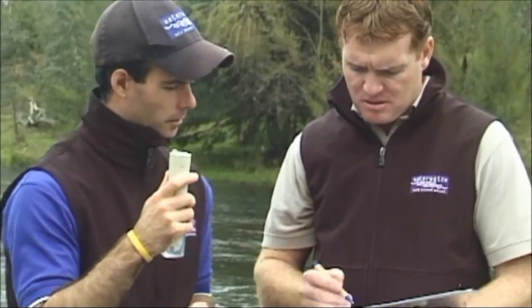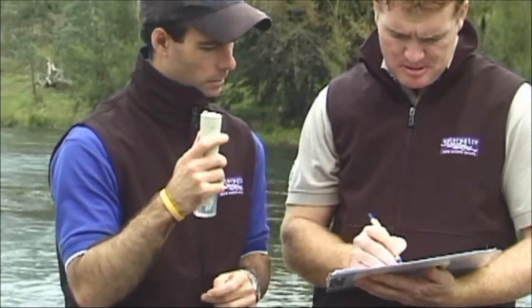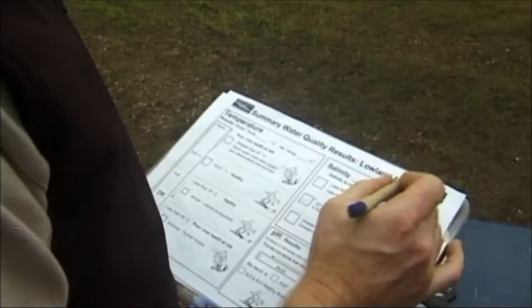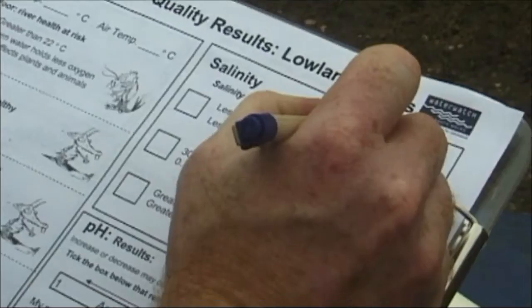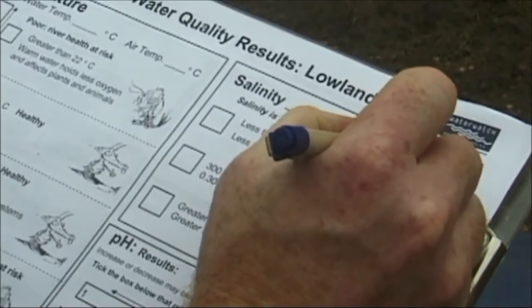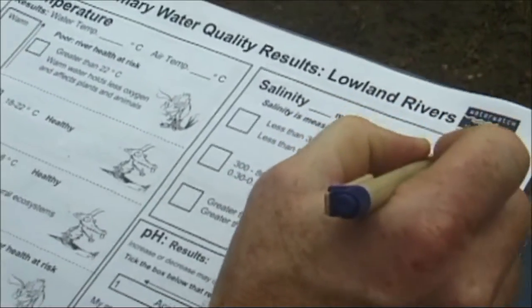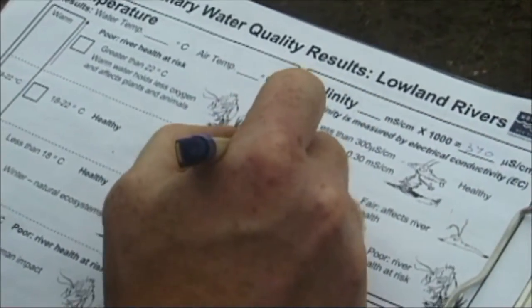If your meter is a low range meter, record your result as it is on the screen. If your meter is a high range meter, multiply the number on the screen by 1000 and record this figure.